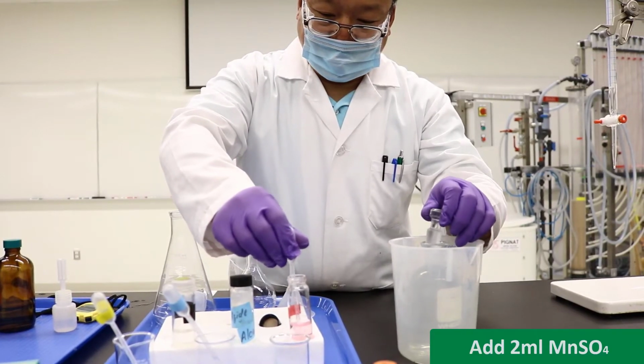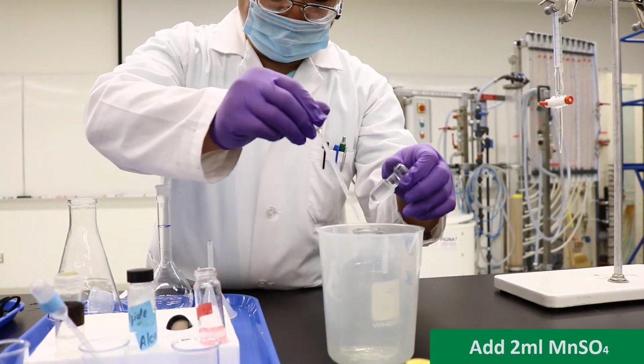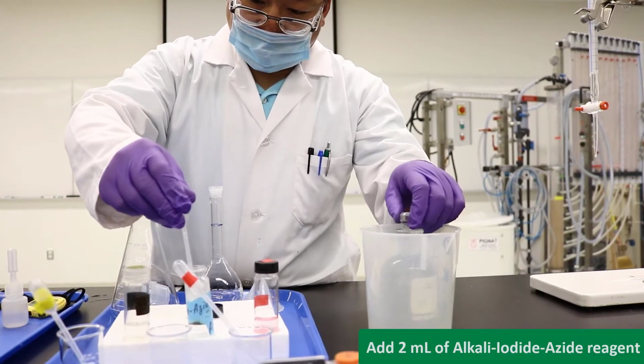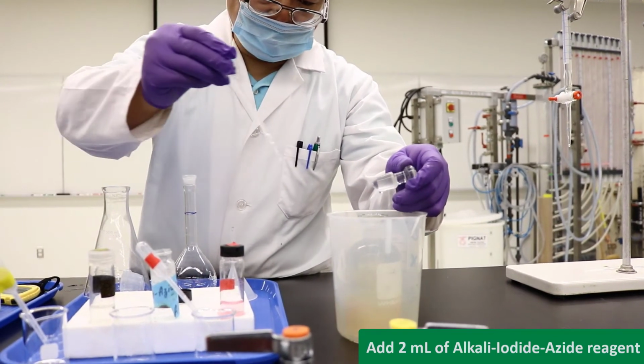Using a disposable plastic transfer pipette, add 2 milliliters of MnSO4, a pink solution. Also note that the disposable plastic transfer pipette has a capacity of 1 milliliter. Using a fresh disposable plastic transfer pipette, add 2 milliliters of alkali iodide azide reagent.